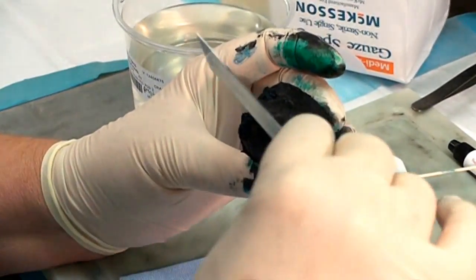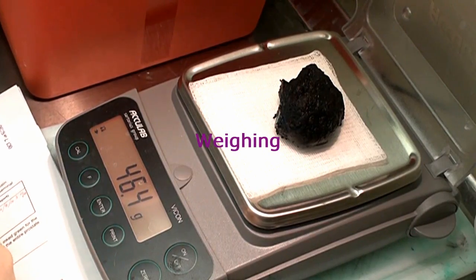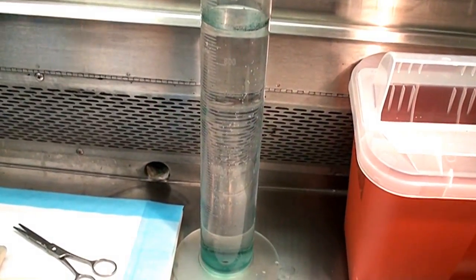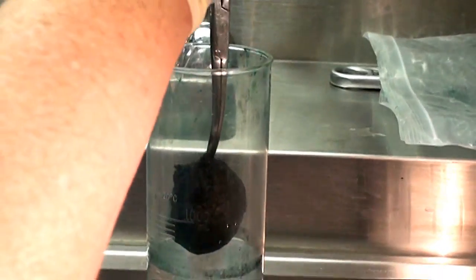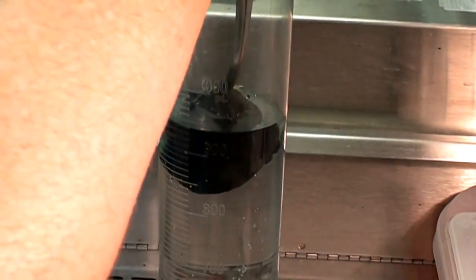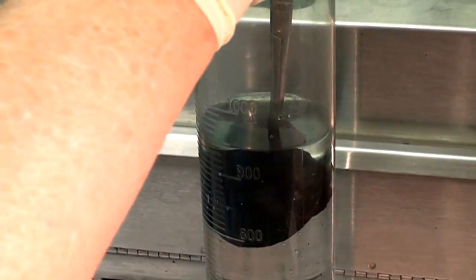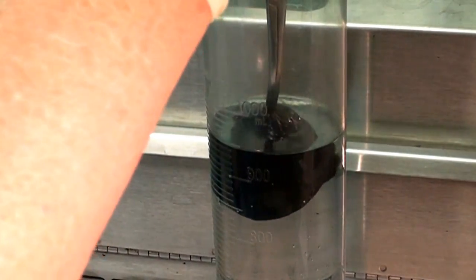And then the length from apex to base: 4.3. Now that we have it measured, we can weigh it. We take a volume measurement by doing water displacement — I've got a cylinder here with 900 ml of distilled water and measure how much displacement we get. It looks like it's right at 50 cc.